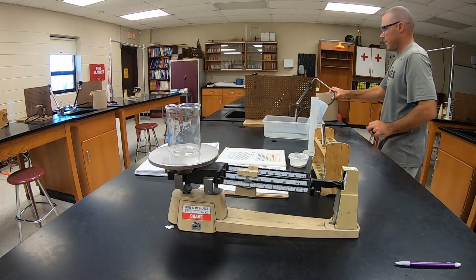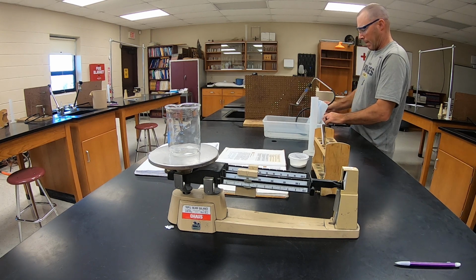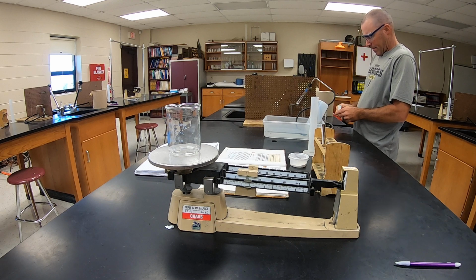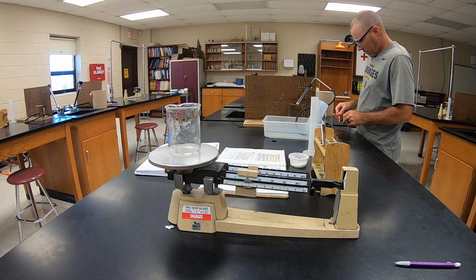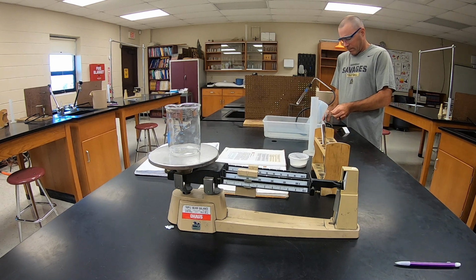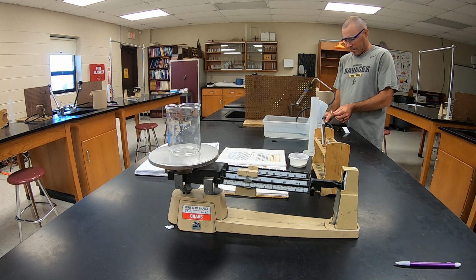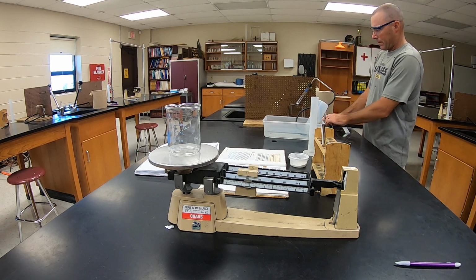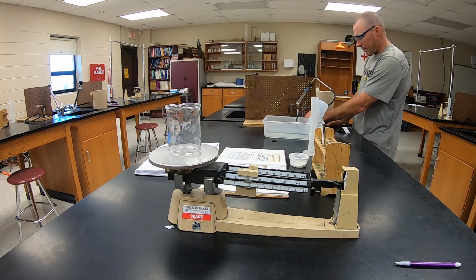And we'll get this started. There we go. Just put it underneath there.